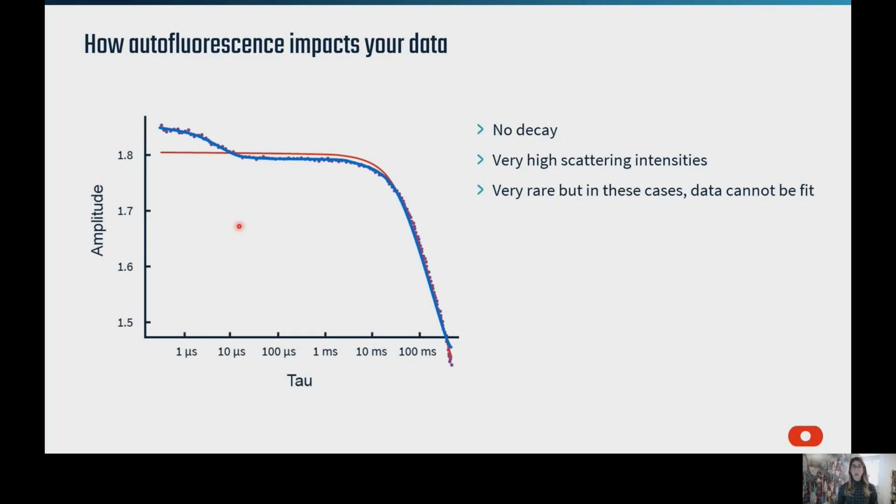And lastly, autofluorescence. This is going to be at the same wavelength as the detector and can create poor autocorrelation functions as well. These are seen where there's really no decay during the acquisition and generally some very high scattering intensities. So while this is quite rare, if it does occur, the sample is not suitable for analysis at the DLS wavelength being used.